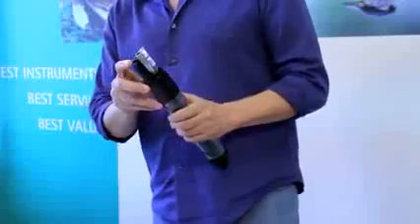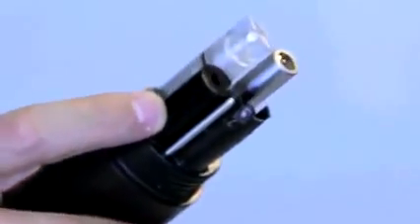This is the temperature sensor. This is the conductivity sensor, which is also total dissolved solids and salinity. This is the pH reference, which you will need for pH or any ion-selective electrode. And this is the optical DO sensor.